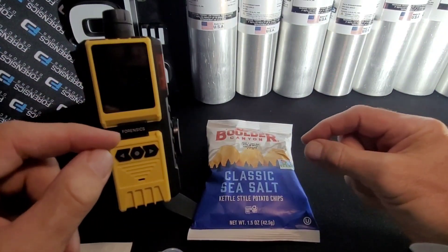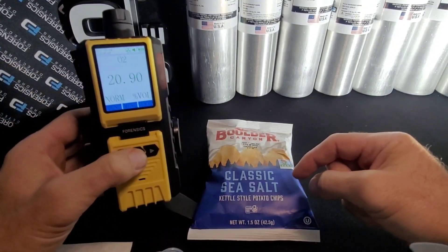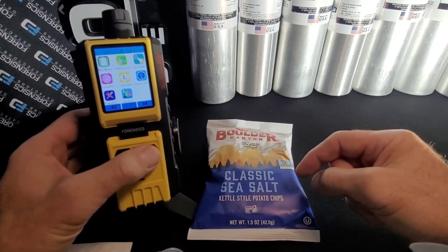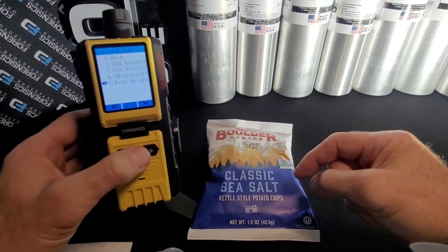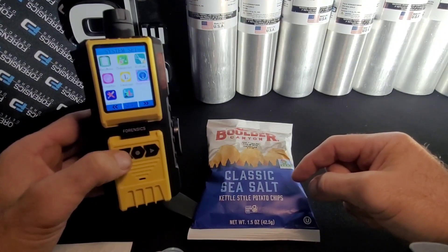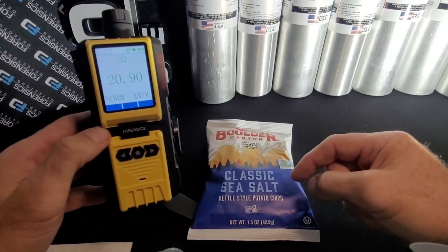Let's start with one thing that we get calls about — the display turns off. Just press the middle button, go to menu, go to settings, click on backlight, go down, keep bright, and make it set so that it never goes blank — it'll always be on. Press enter. That's the way to adjust the screen so you don't get that annoyance.